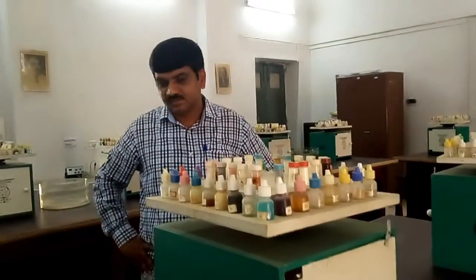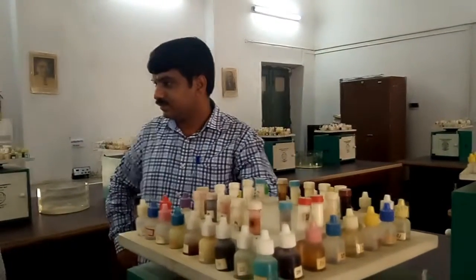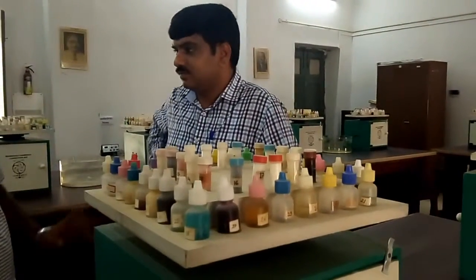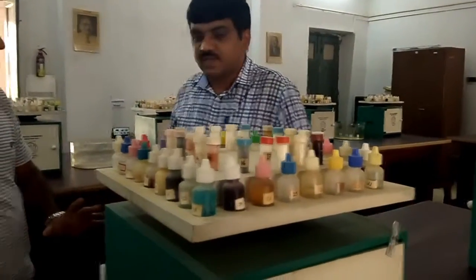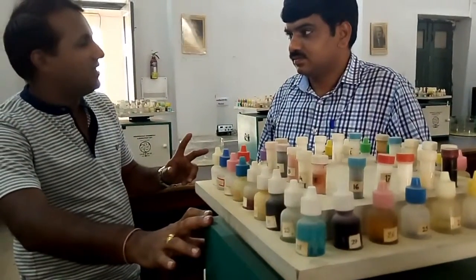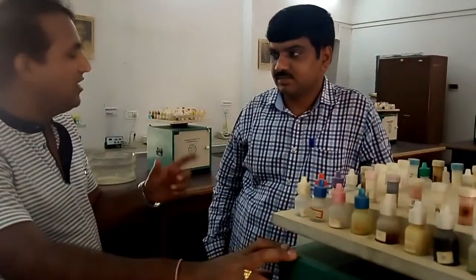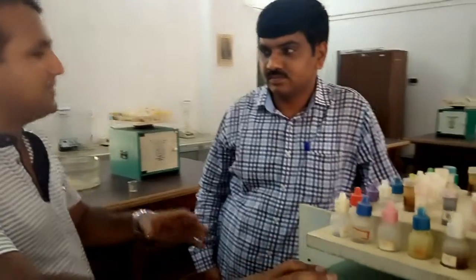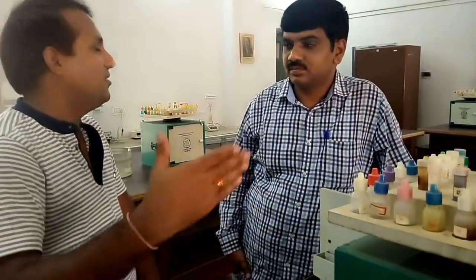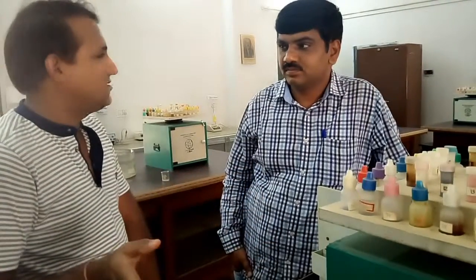You can purchase this kit from NCERT. There is a Department of Education that prepares this. The cost is hardly 4600 rupees. They have a separate pricing category — if you are taking it for a government school or office, the price is lower. But for private or public schools, the price is different.